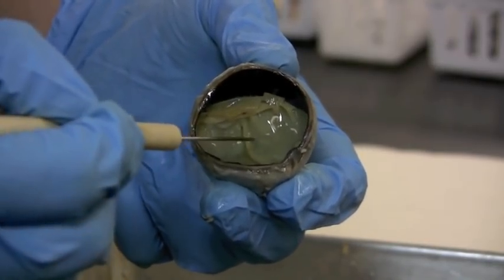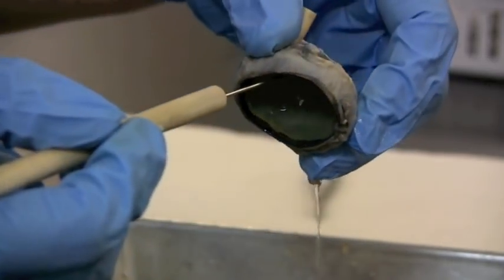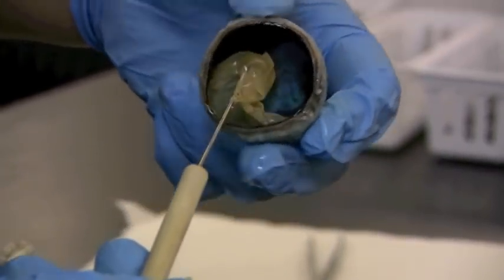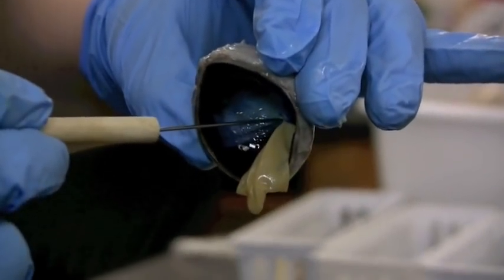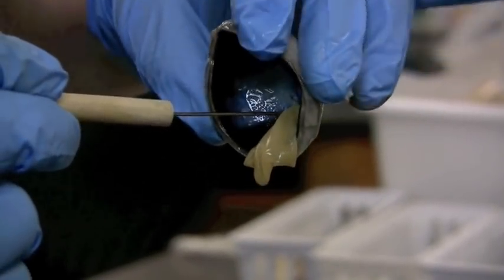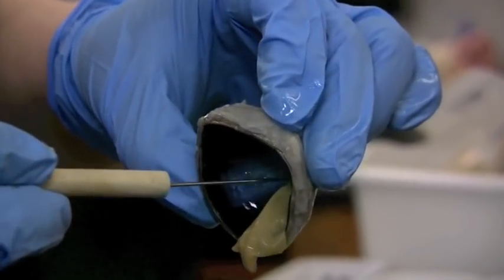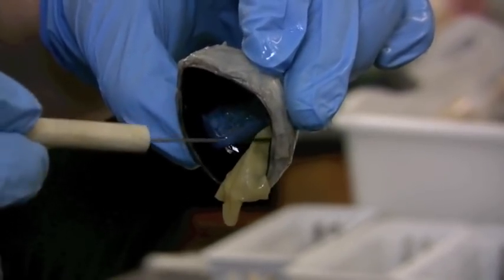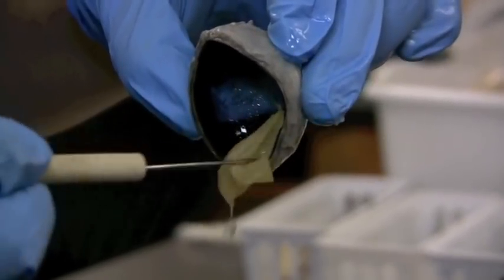Because that membrane is held in place basically by the vitreous humor, as soon as I let out the vitreous humor, it's starting to fold up and want to come right on out. I'm just going to gather up the retina and let it fall right off. It doesn't come all the way out because it's connected at the very back here. This is the optic nerve. So if I turn it around, you can see that's where the optic nerve exits, so it's a connection with that retina turning inside out, like I said, to go into the optic nerve. This whole thing is the retina, the retinal layer.